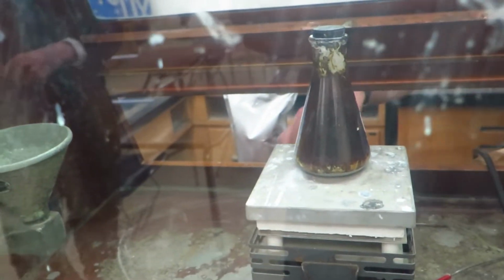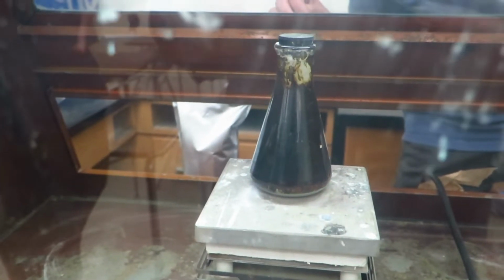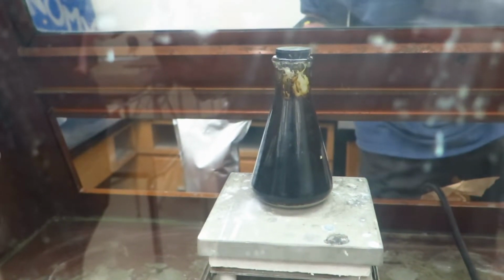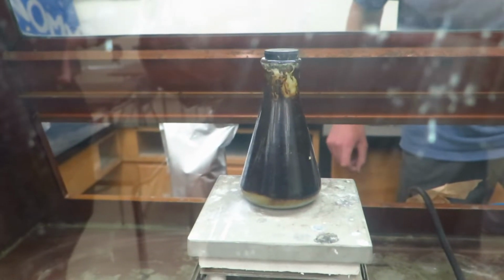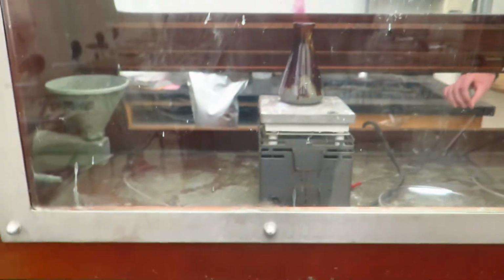Turn off the heat. And don't do anything because I don't want any of that out. Some of it's escaping. Well, that's why I have the fume hood. What? So, and stay away from it because if it's, oh geez. Get away. Axel, just stand back. Well, this might make a good thumbnail too.